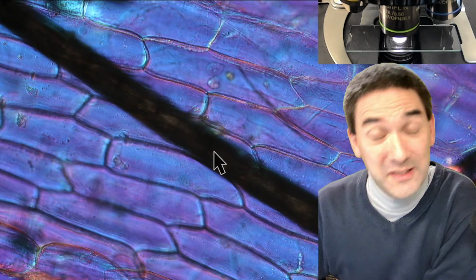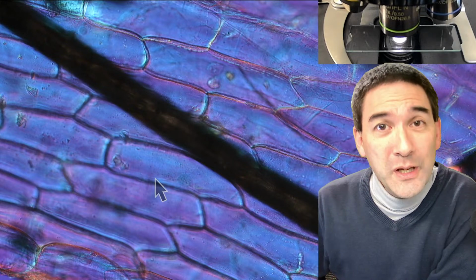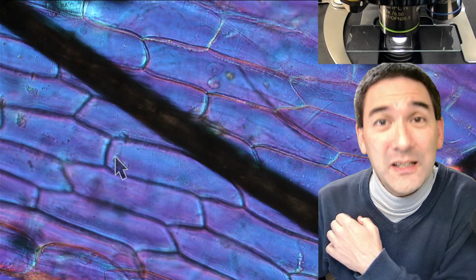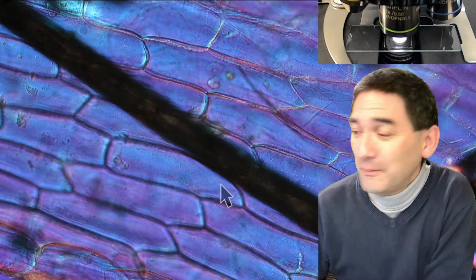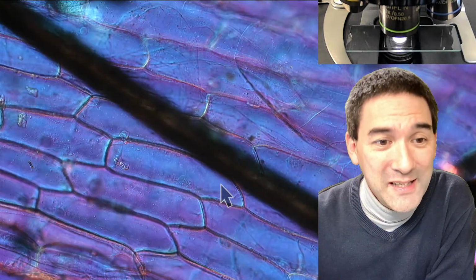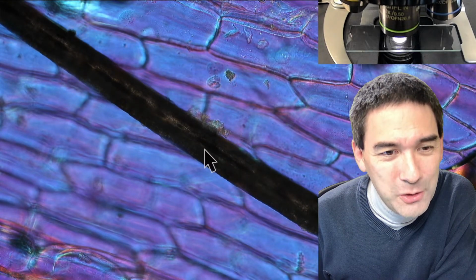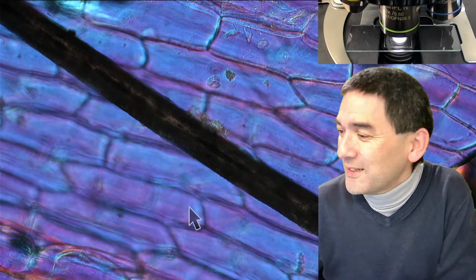Obviously, there are cells that are much smaller, right? But those onion cells are pretty huge. And as a matter of fact, if your eyes are good and you take a good magnifying glass, you're actually able to see those cells with a magnifying glass. I just wanted to illustrate the size relationship a little bit. You can also barely see that the inside here is a little bit darker again, so you see again the medulla. I think that's kind of nice.